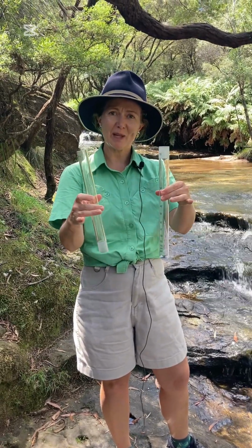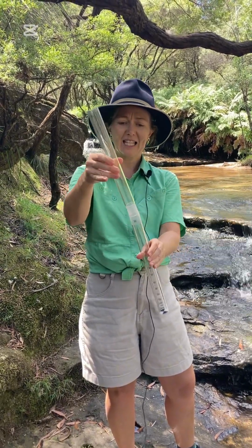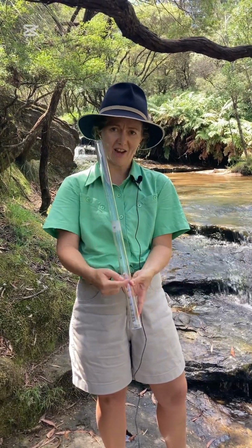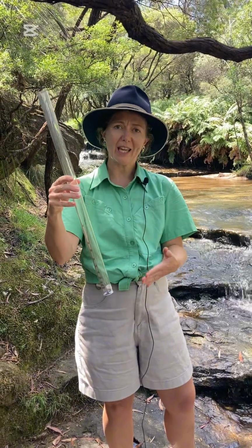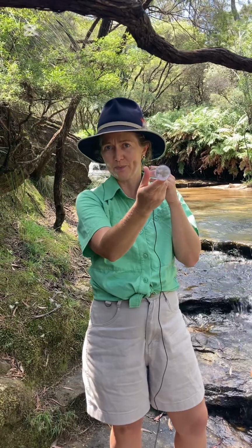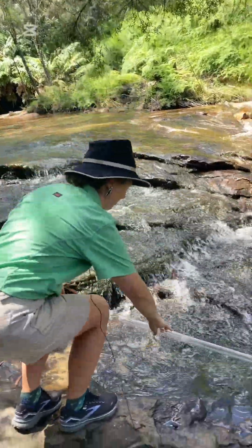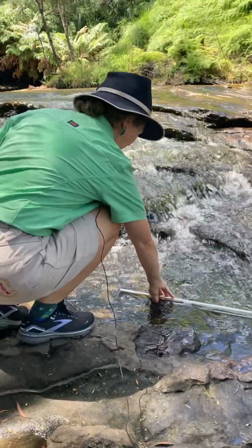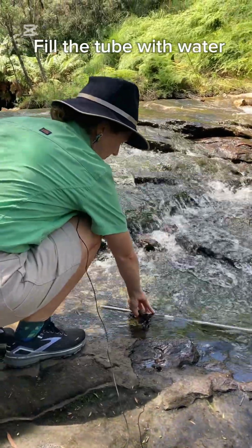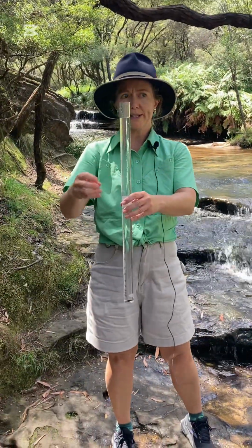And I'm using this turbidity tube. We are going to slot it together like this, very carefully, and then line up the numbers down the side. So in order to take our measurement, we need to be able to see the black and white marking on the bottom. And we then need to take our sample by lying it down in the water until the tube is full of water.